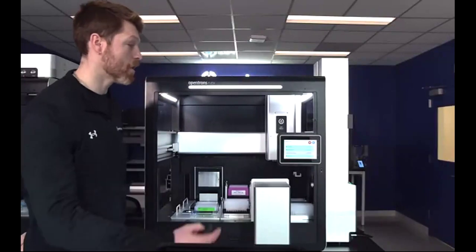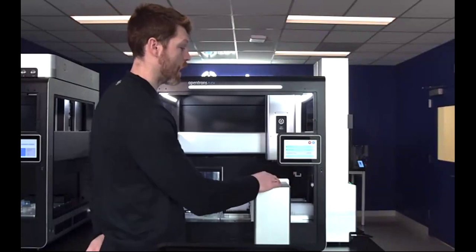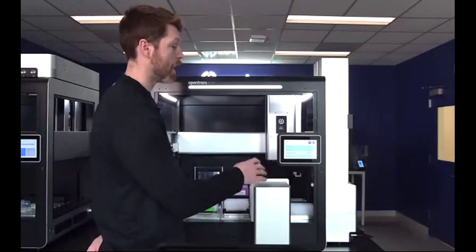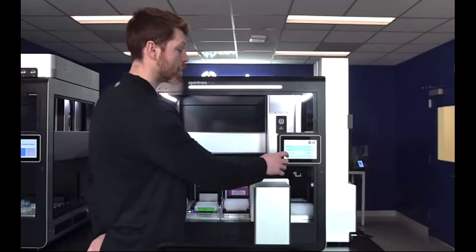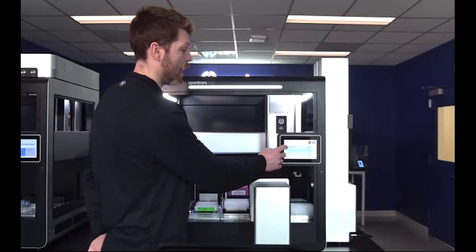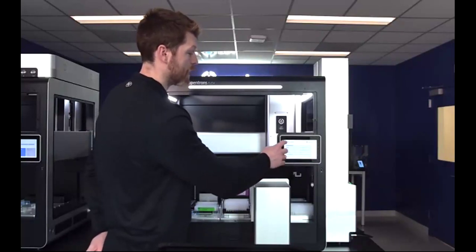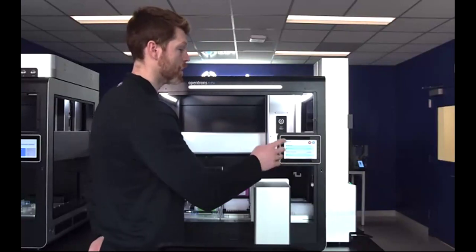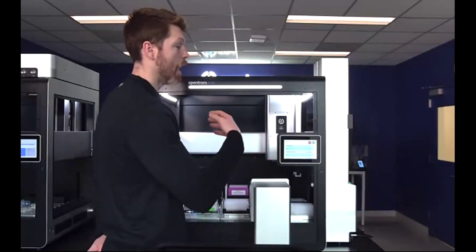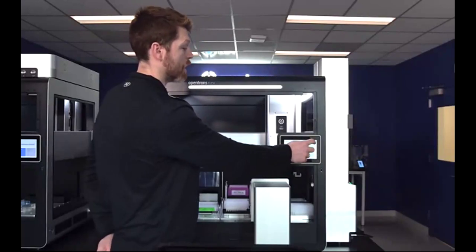So I'm going to go ahead and start this protocol here. I've already gone through and made sure that all of my instruments and my deck hardware align with this protocol. I've also already made sure that all of my labware position checks are in place. And I've already chosen my runtime parameters here. So we are going to be running this as a dry run. Throughout the protocol, the thermal cycler will just open and close instead of doing a whole run through. But this does allow you to really change and optimize how protocols work using runtime parameters.